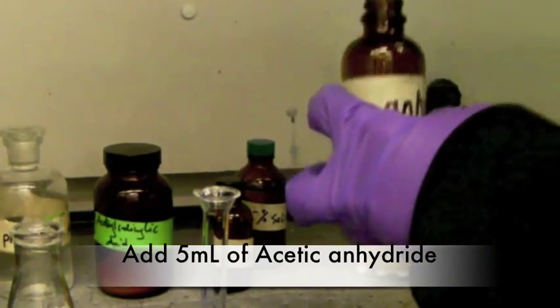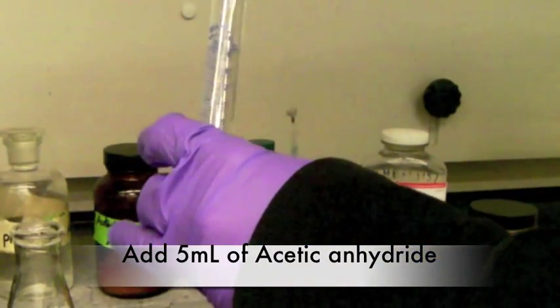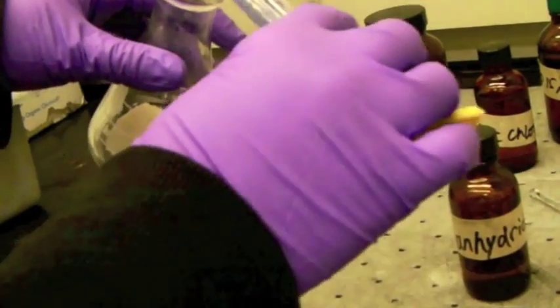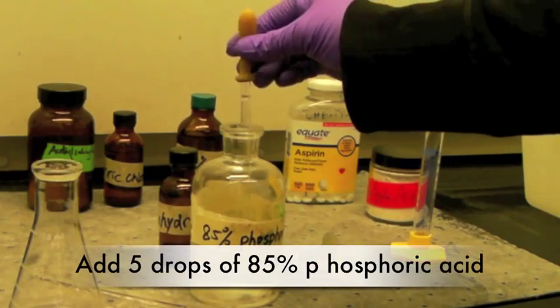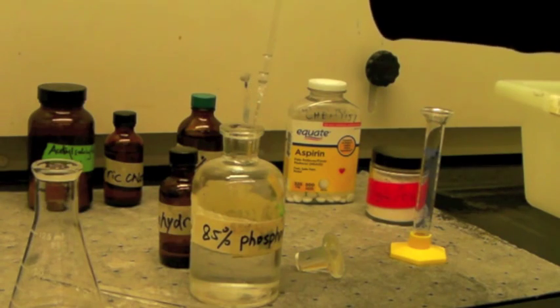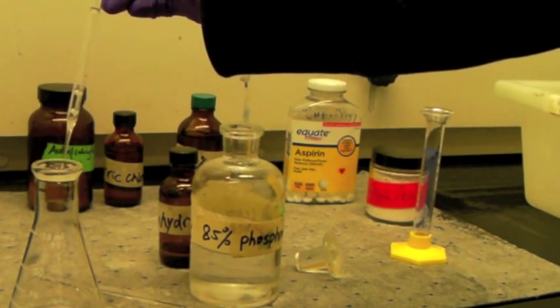Add 5 ml of acetic anhydride. Slowly add 5 drops of 85% phosphoric acid. Stir the mixture with a stirring rod.